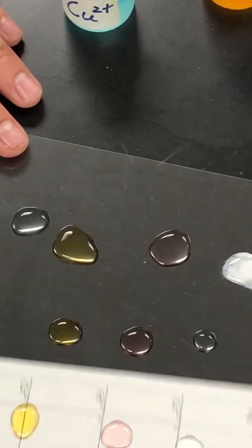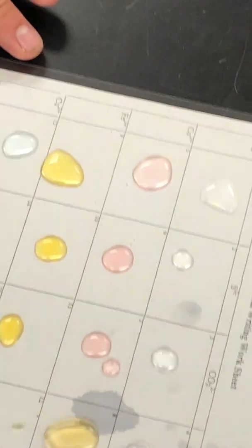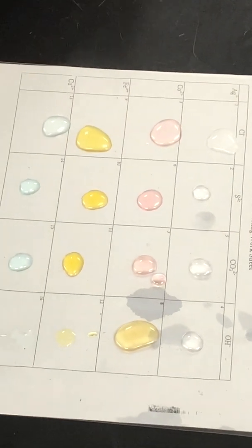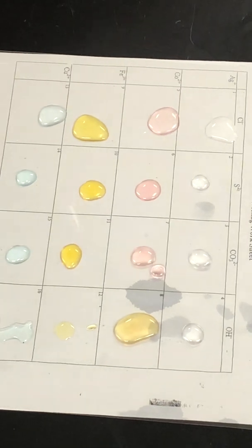And sometimes we pull it off here, if I can do it without making a mess, you can see a little bit better. You can definitely see that top one reacted. All right. And what happened here? I'm not gonna move it again to the end.